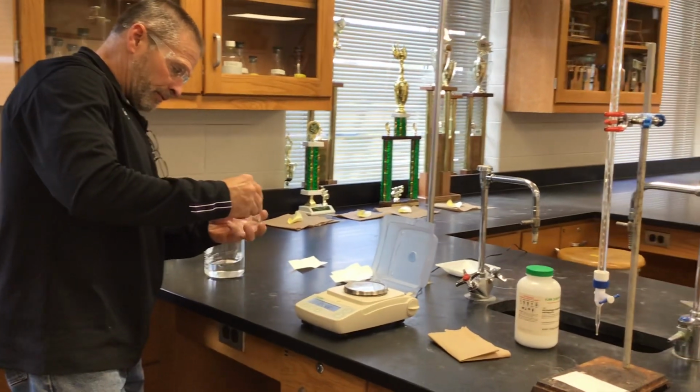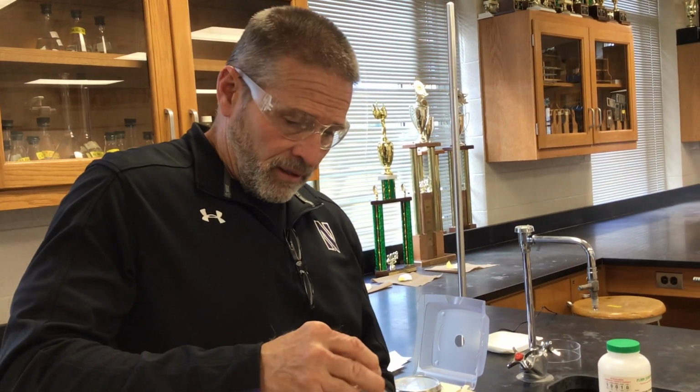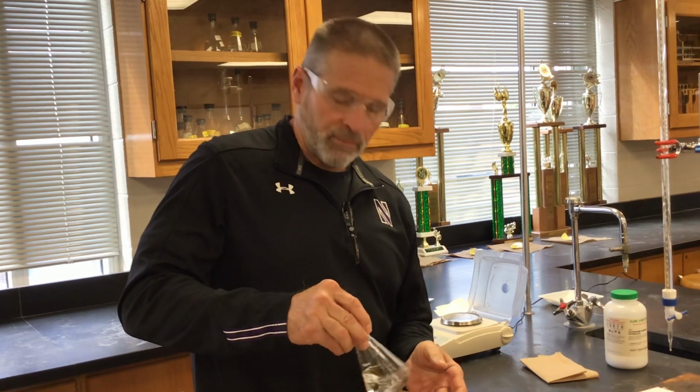So will we want to use that first trial in our calculation of the concentration of the sodium hydroxide? Well, it was fast and sloppy. I think it has to be in our data because we did record a measurement, but personally, I wouldn't use it in my final.